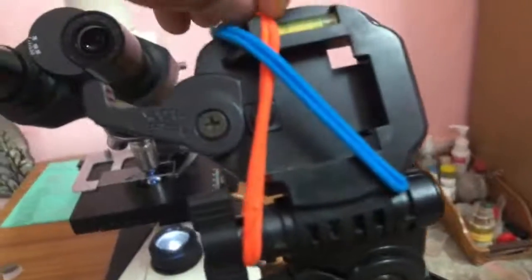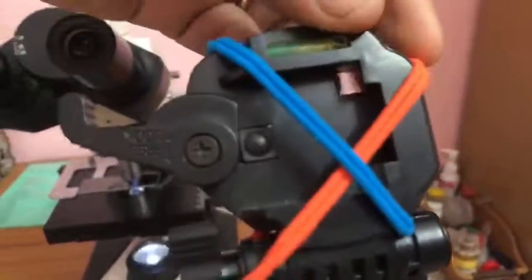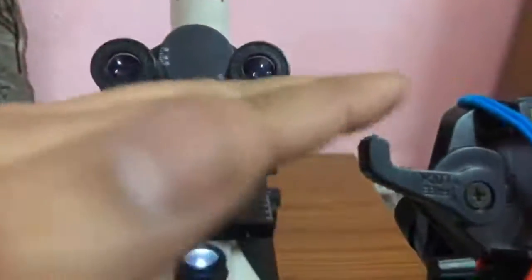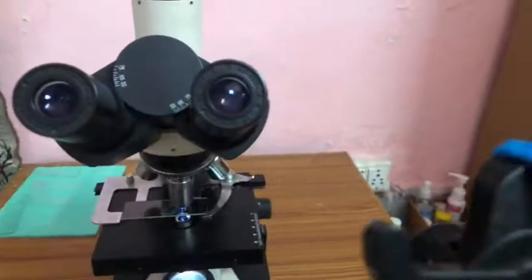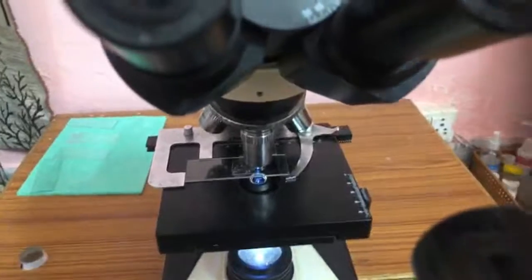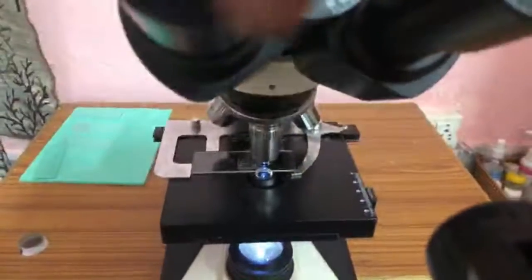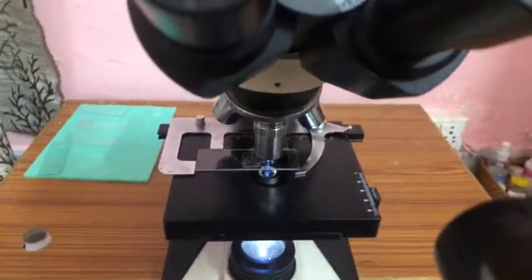So here is the arrangement that I generally do for this live telecast. I'll have these elastic bands fixed at the tripod, and once it is done, the cell phone will slide in here, and then I will bring the cell phone in close approximation with this lens, and we can see the happenings on the slide. So here I go. It takes about a minute to adjust and stabilize, but once it's done, it's very reliable unless there is a mishap.